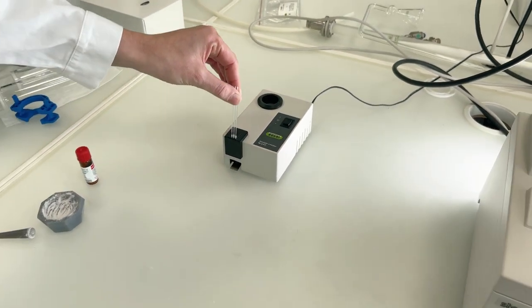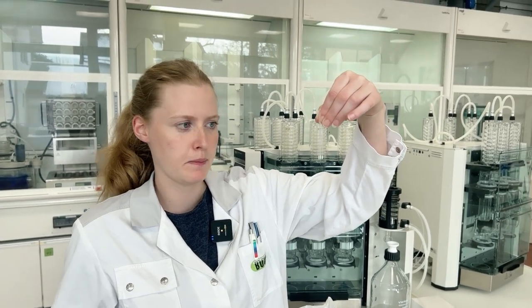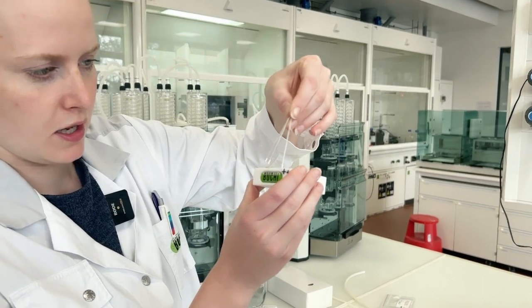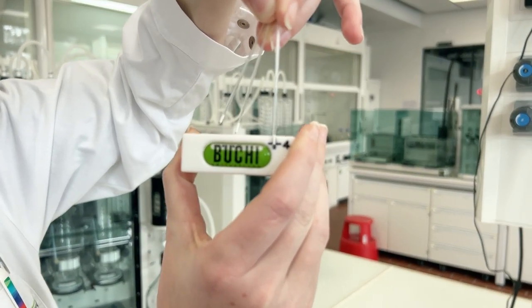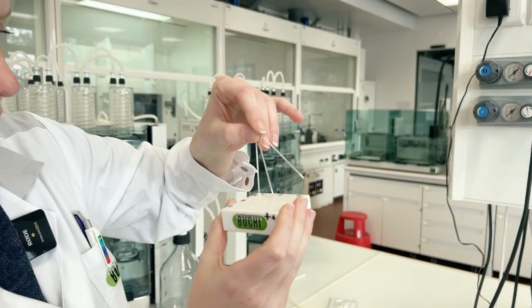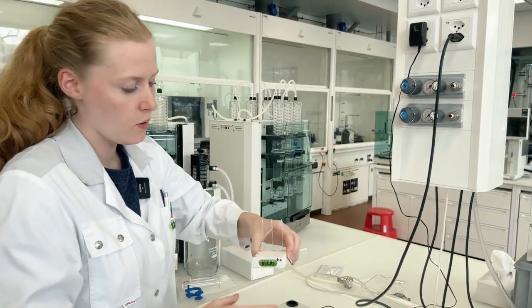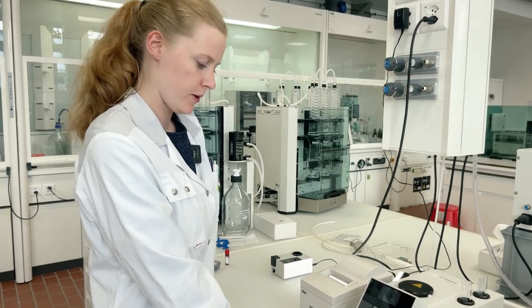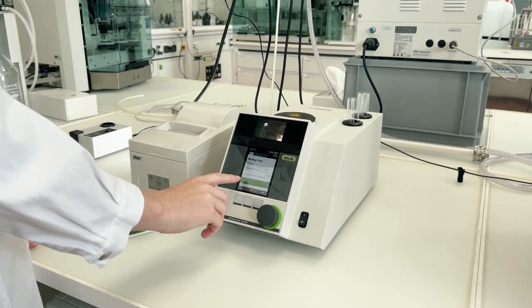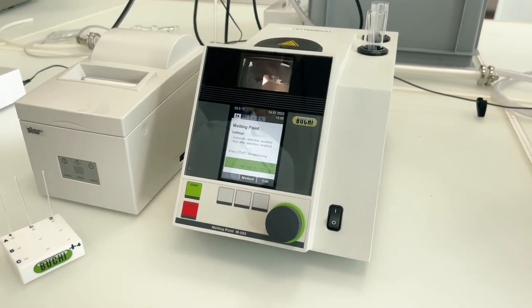The samples need to be filled to between four and six millimeters, which I can check with the sample holder — they need to reach one of the marked lines. Now let's enter the parameters into the melting point device. I have three parameters I can change: the starting temperature, the end temperature, and the gradient.